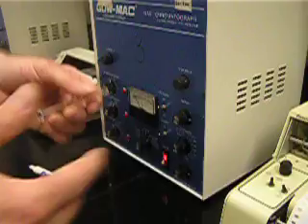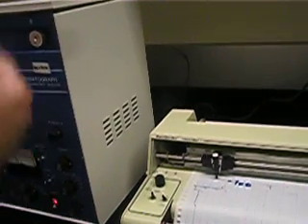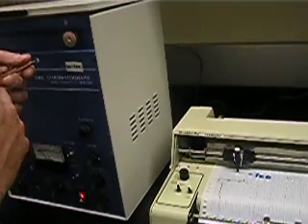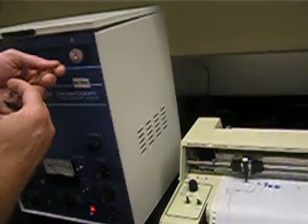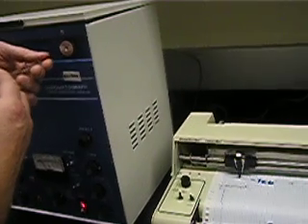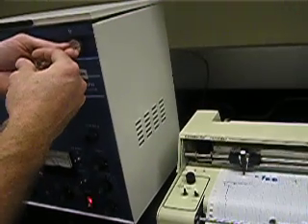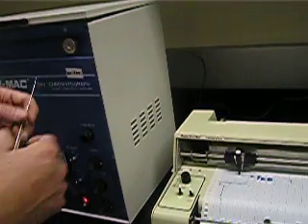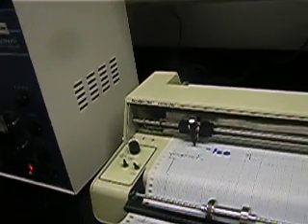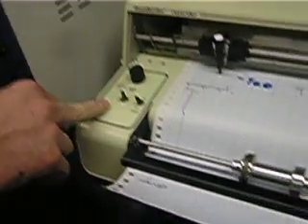Once the liquid is in, I'm going to inject a lot of air so we can see the needle move just a little bit. If you have liquid, the needle will move a lot — liquid injected gives you a lot more sample running down the line than just gas injected. When you inject, watch the position. Have one hand close to the tip of the syringe to guide the needle into the septum, and the other hand on the back holding the plunger, because the pressure can push the plunger right out against your sample. Inject as quickly as possible, then pull out. Lastly, make sure your partner — as soon as you inject, not when you insert the needle but when you inject the solution — flips the chart paper on. You want to be at two centimeters per minute as your chart speed.